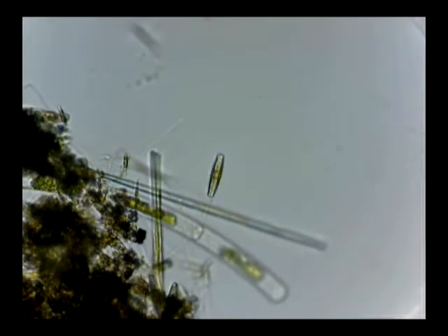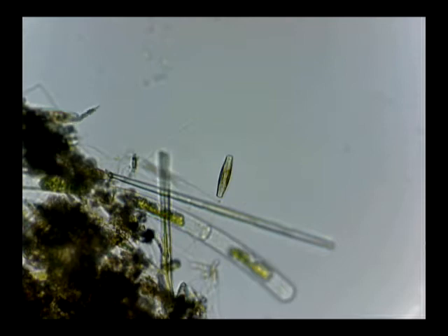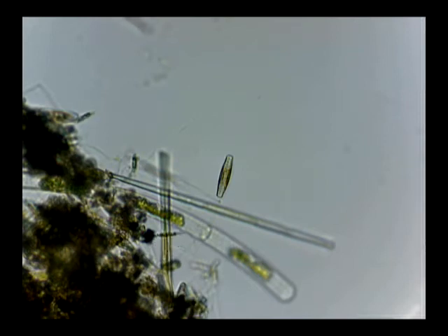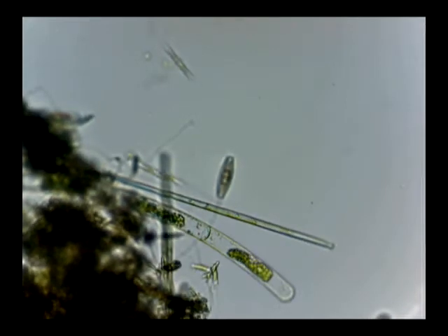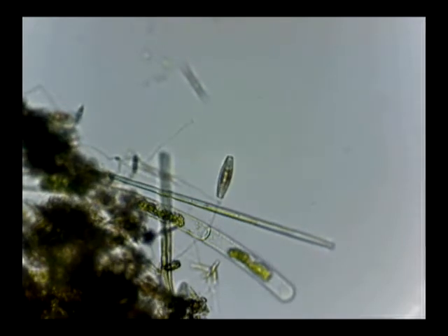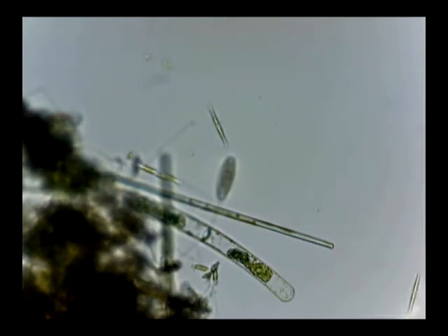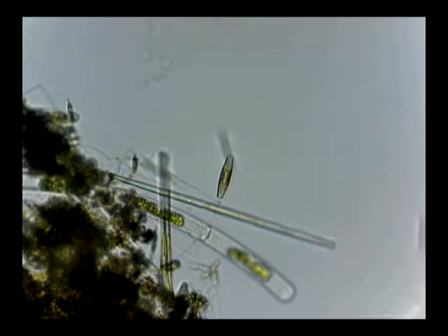Now we've moved in a step and there's our diatom right there, recentered. Now you can just barely start to see that inside the structure of the diatom there is a faint flickering kind of motion. It's either a mass of bacteria moving around in there, or it's the organelles that make up the creature — I don't know, that's what we're going to find out. You can see more detail on the algae as well. There's a long diatom there, and also some thread-like things — what I believe are probably bacteria, like those whip-like things that were in the other video. And there's a diatom in motion there, but again we're focusing on this one right in the center.